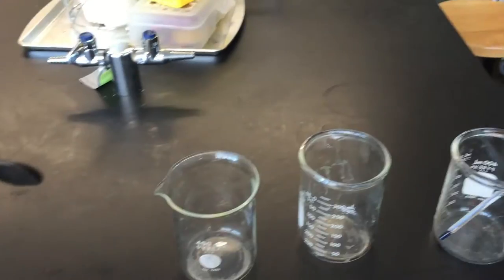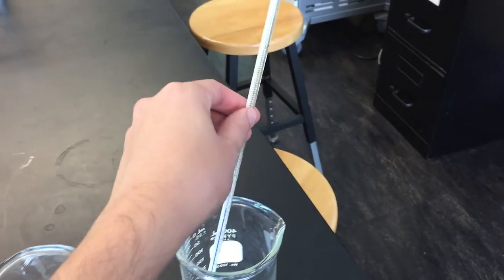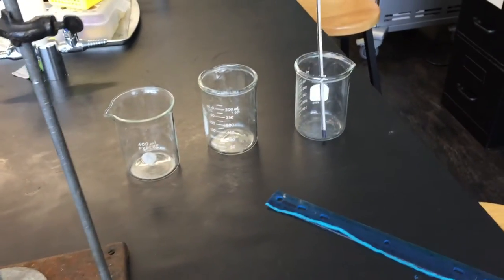Remember that when we're measuring our temperatures of all of our liquids here, we're going to need to convert from our Celsius on here to Kelvin, otherwise it's not really going to work.